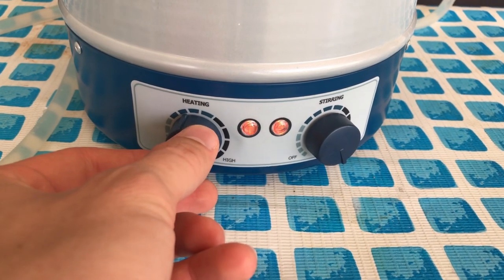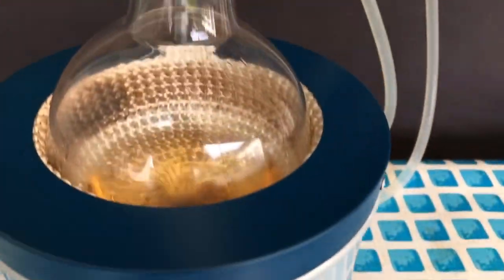At the beginning, a lot of HCl gas escaped. The mixture was perfectly clear at first, but as we stirred and heated it, something interesting happened. The mixture quickly became opaque.